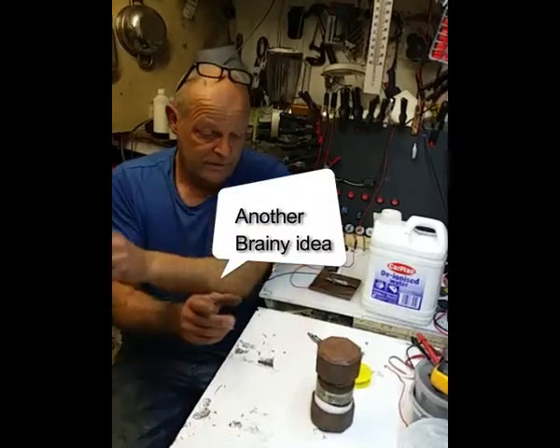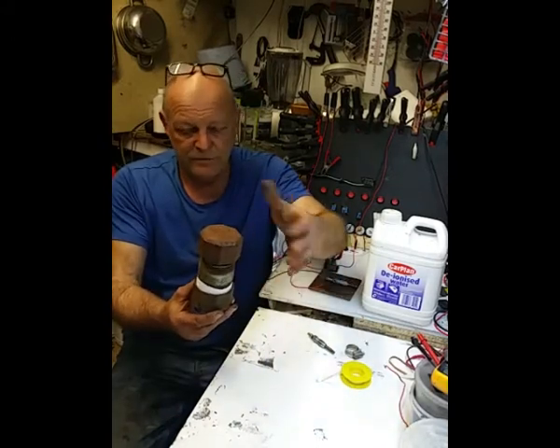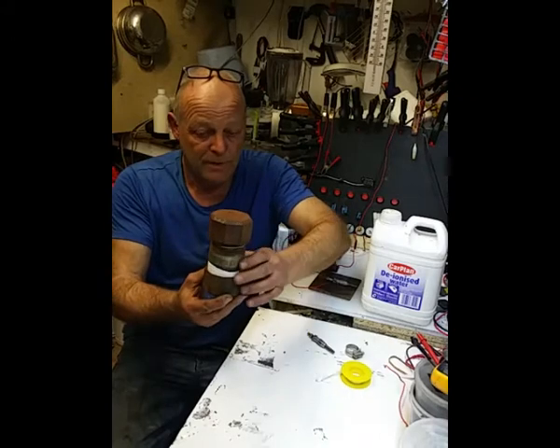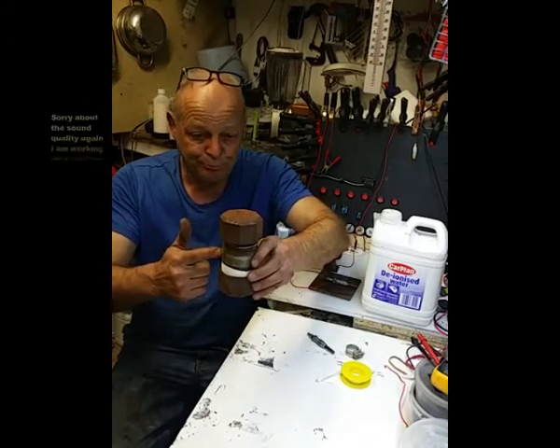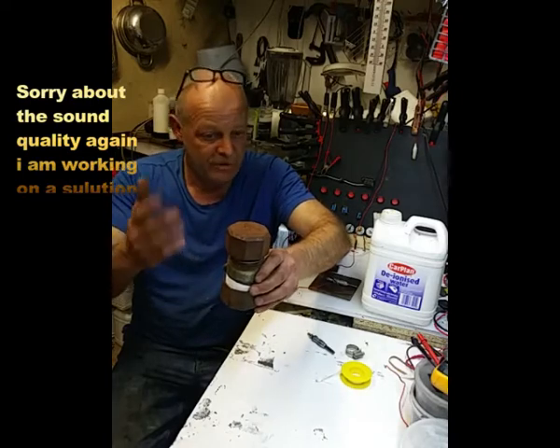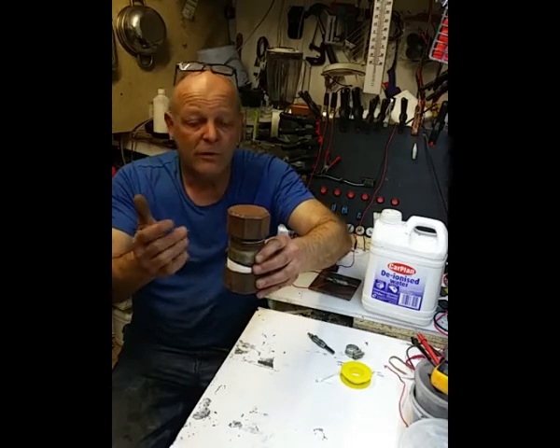Okay, so this is an update video really. I said in one of my previous videos that I was going to do this, and I've actually done it now. What we've got there is courtesy of Robert Murray Smith again, credit where it's due. He came up with this idea and showed us.